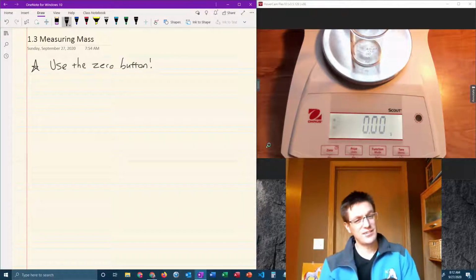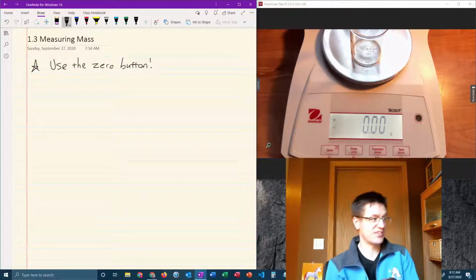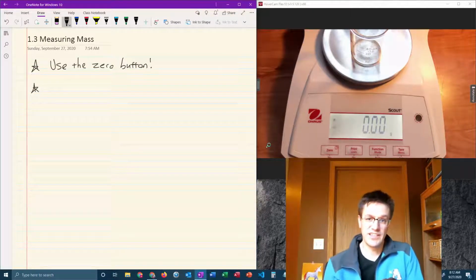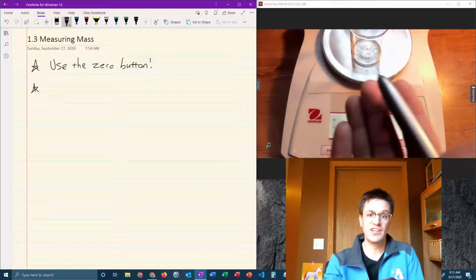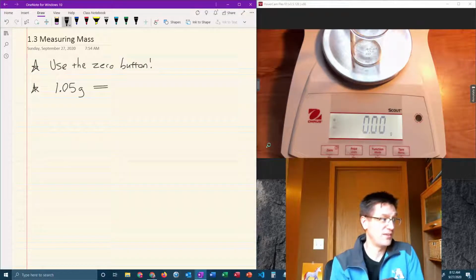Okay. Next thing is about place value. This is more of a math mistake than it is a chemistry lab mistake. But every year I give a little mini quiz and I ask students to please put 1.5 grams of this substance into the beaker. And every year I see a lot of students, they'll fill the beaker up with 1.05 grams. Well, that is not the same number as 1.5 grams. Okay. This is 1 5/100ths of a gram.